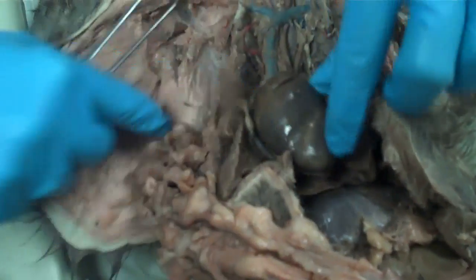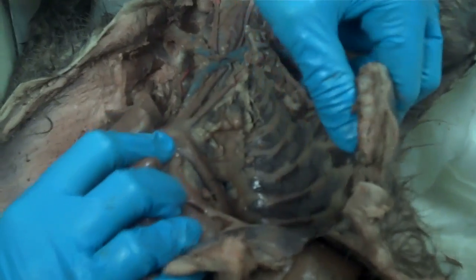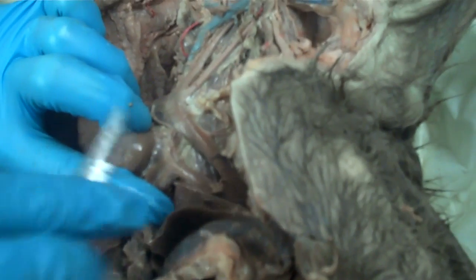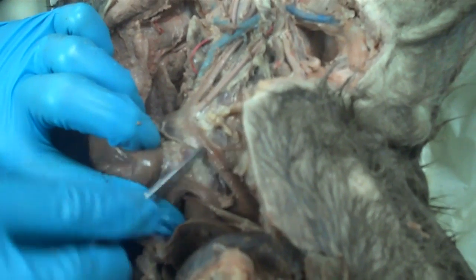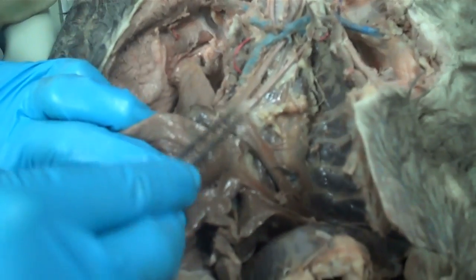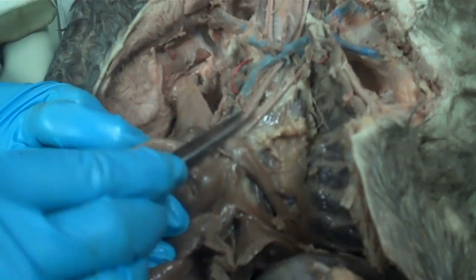At the very top of the heart you have to clear everything out, and sometimes push things aside, so you can see the aorta. Because it's in the chest area it's called the thoracic aorta. If you follow it up, it kind of arches, and there are two vessels that come off the top of the aorta.